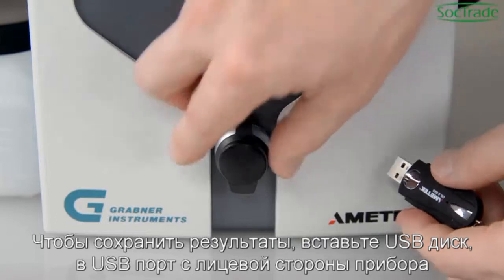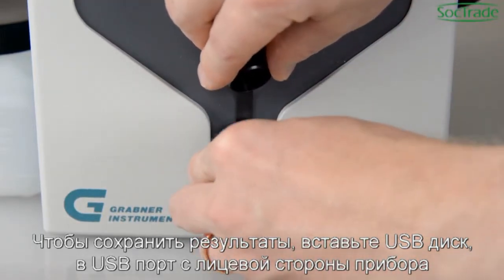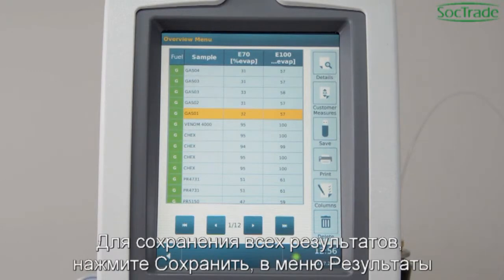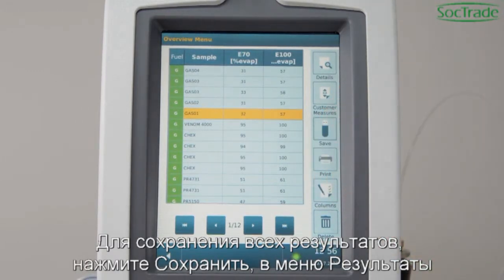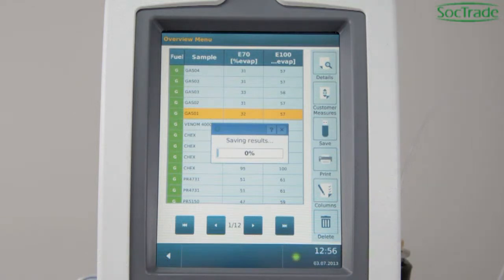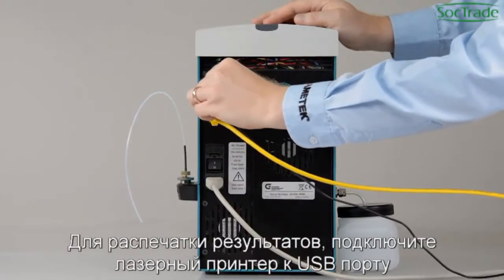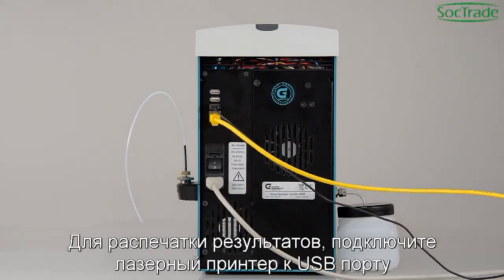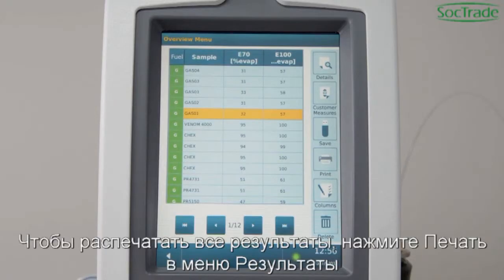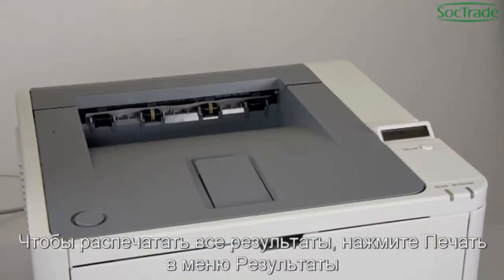To save results, insert a USB device to the front port. To save all results, click Save in the results list. To print results, attach a PostScript printer to a USB port. To print all results, click Print in the results list.